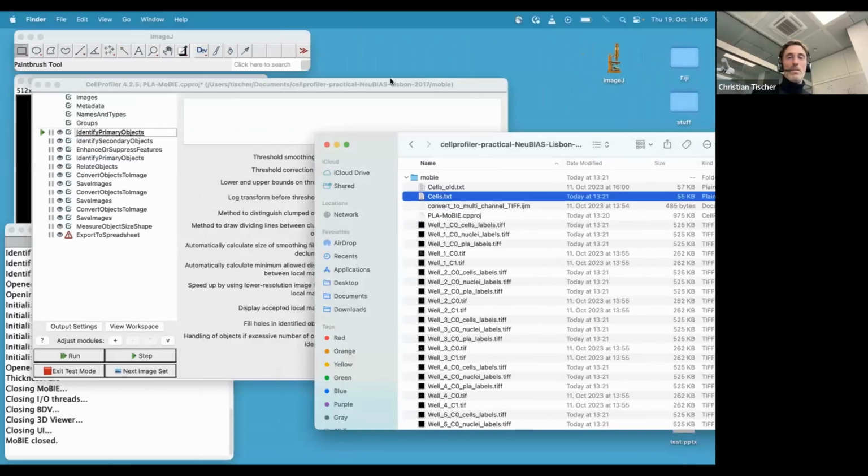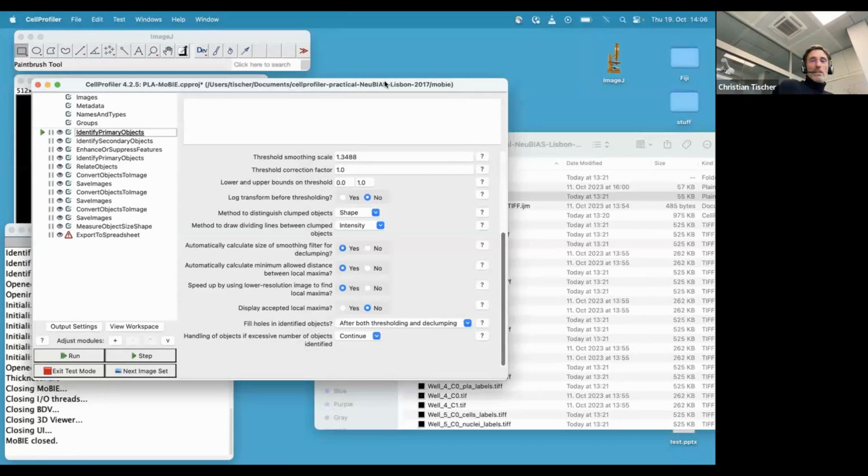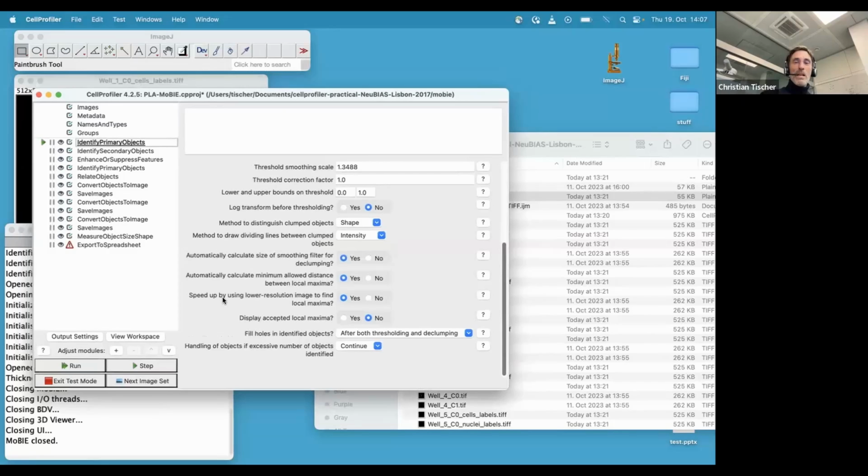So let me go to CellProfiler. All the material that I'm using for CellProfiler is also linked in the forum thread. So there's a GitHub repo, so you can download everything. I guess some of you might have seen CellProfiler. If not, I will just quickly step through this pipeline that produced the data that we want to QC.